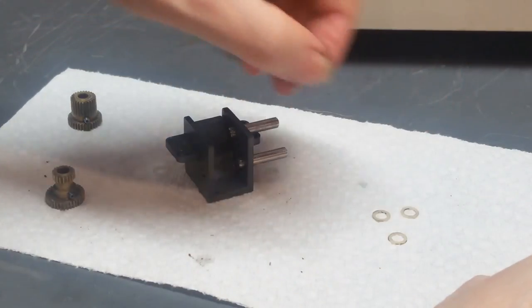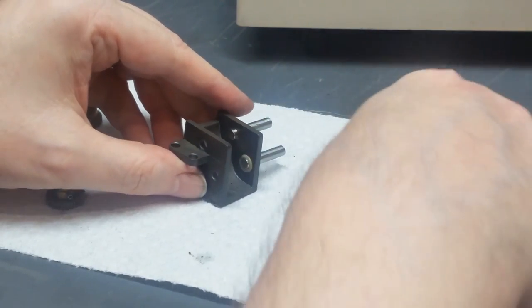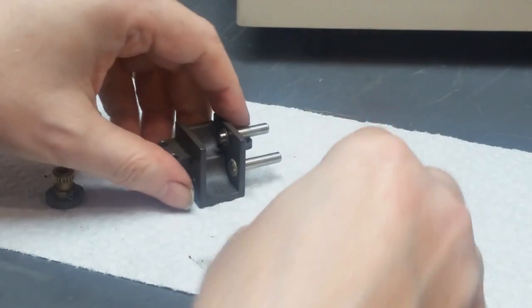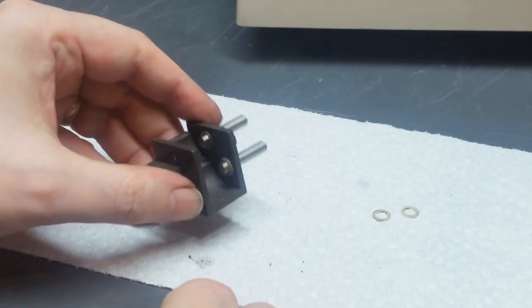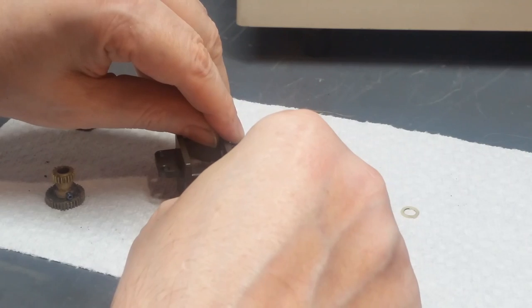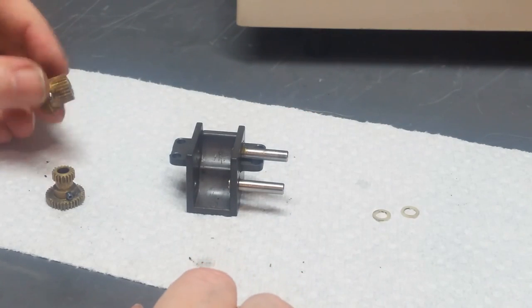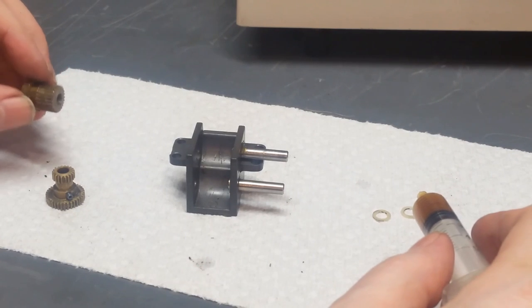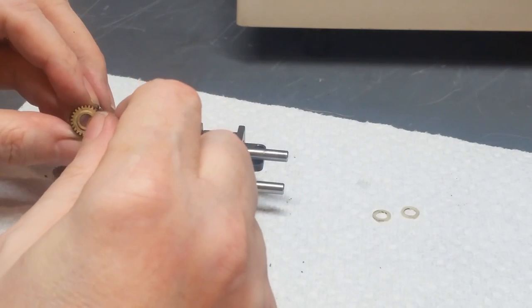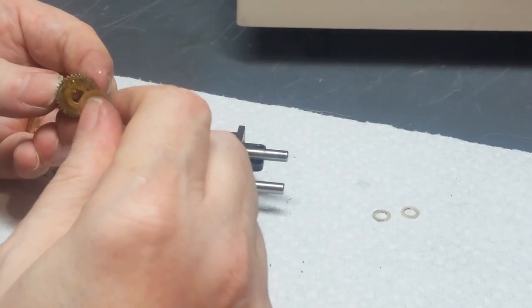Okay. I'm going to take these thrust washers. I'm going to put one over the end of each of the two shafts that are protruding inside the housing. Like so. Now what I'm going to do is back these shafts out so that they don't really stick in at all to speak of. And I'm going to put the two gears in place now. It's important that you make sure that when you put the gears in, you put them in the same way they came out. Otherwise, your gearbox won't work properly. Well, I'm going to put a little bit of grease on the end of this gear here. Both ends.